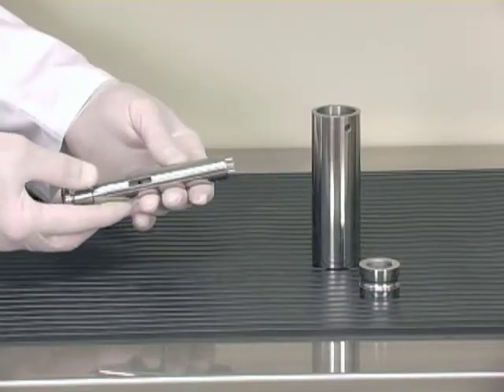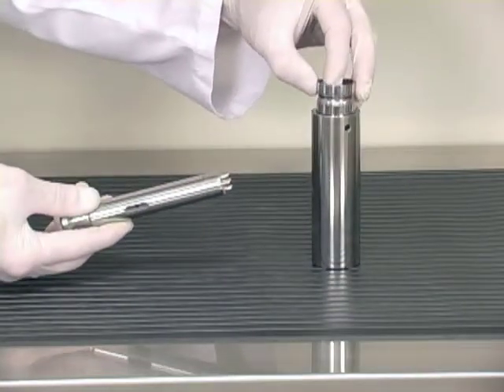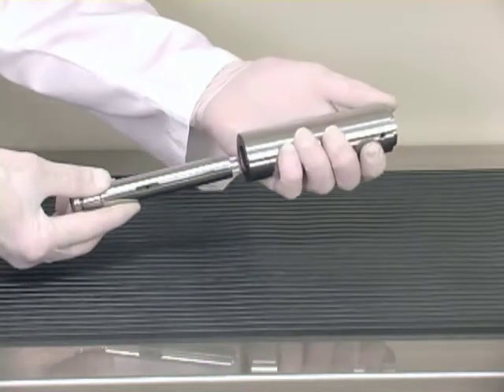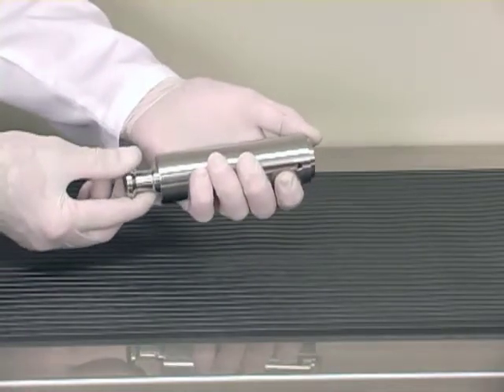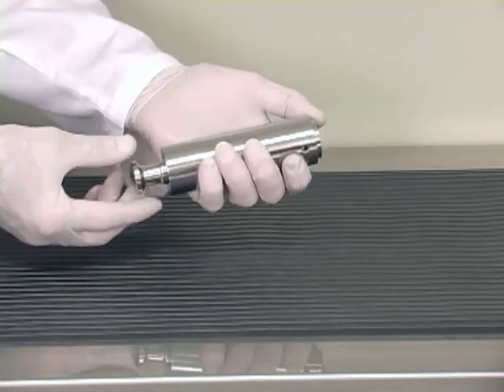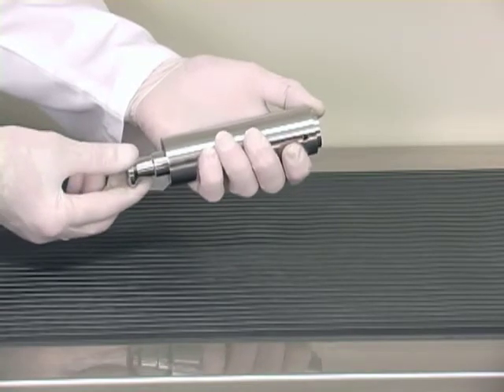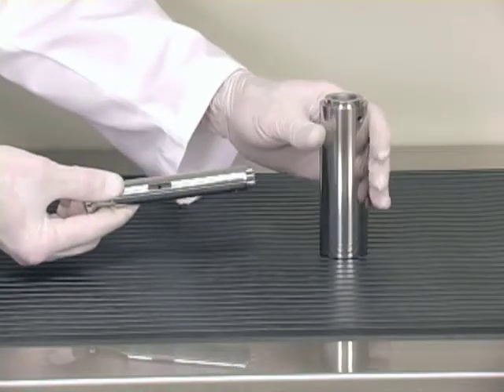The last thing we will do is inspect the punch using the set die and the alignment gauge. We're going to check each possible position of the bore pattern of the die. This one fits real nice. No hang-ups. It's a good punch.